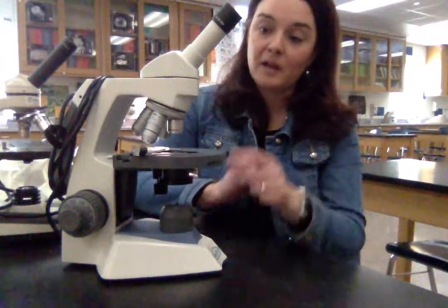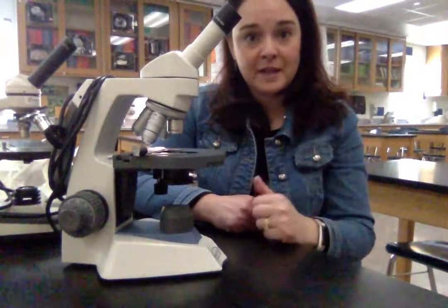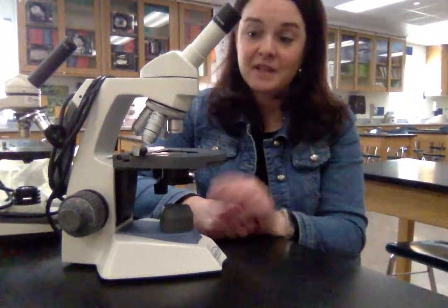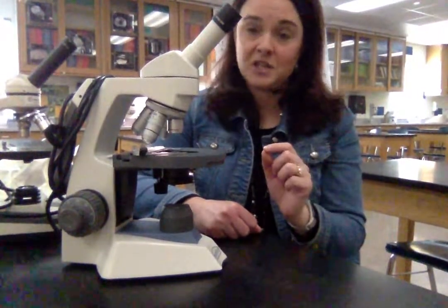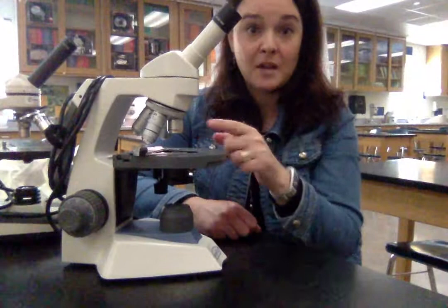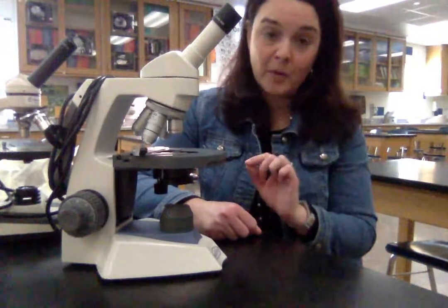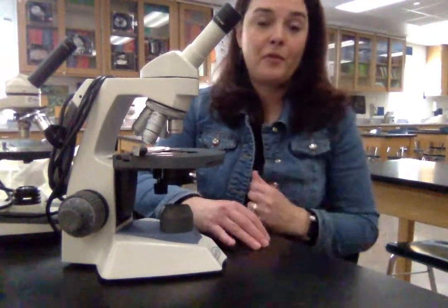The rotating nosepiece is right here, and these are the objectives. The objectives have lenses in them — the shorter objectives have a lower magnification. This one is red and labeled with the number four; the lens inside this short low-power objective has a magnification of four times. Looking through the eyepiece on low power, the total magnification is 10 times 4, so our low-power magnification magnifies the specimen 40 times — still quite a bit, far more than a single magnifying glass.